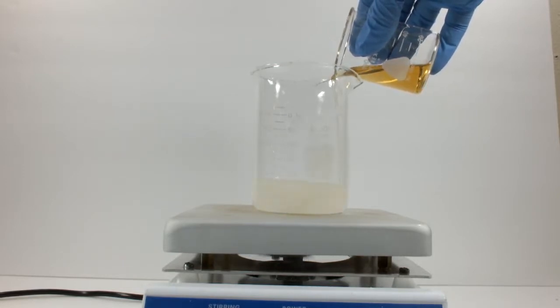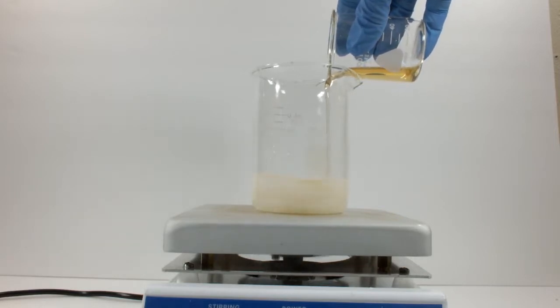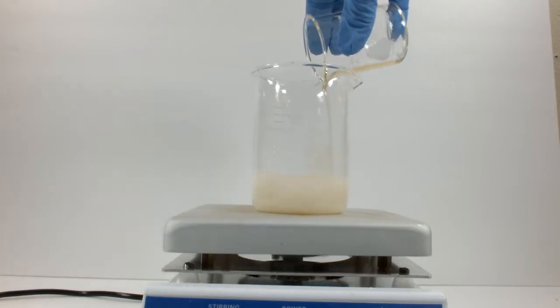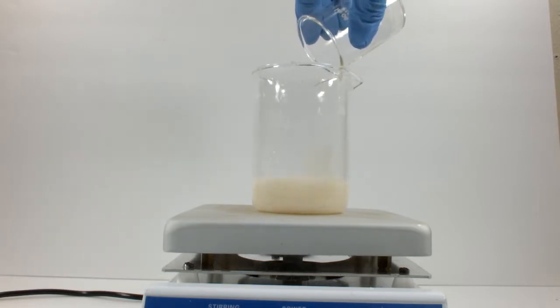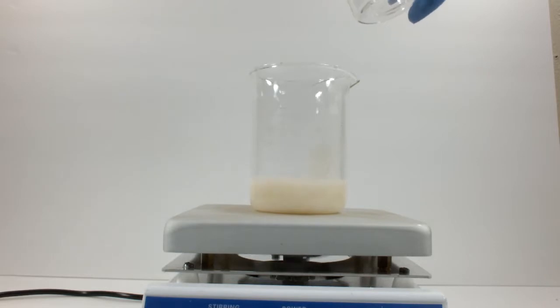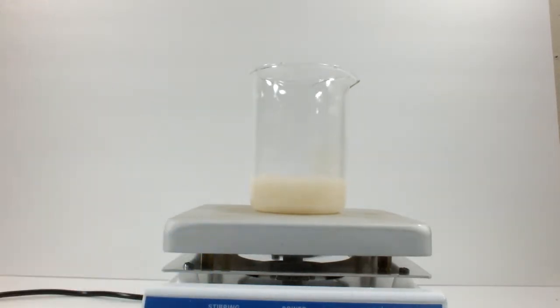Mine is a bit aged, so it's a little darker than fresh material. That doesn't matter. As you can see, it lightens up when added to the sodium hydroxide anyway. After it has all been added, the oleic acid is deprotonated to the oleate ion. It starts to dissolve, and within moments the mixture gels up and the stir bar can't move very well. This is well beyond the saturation point for sodium oleate.